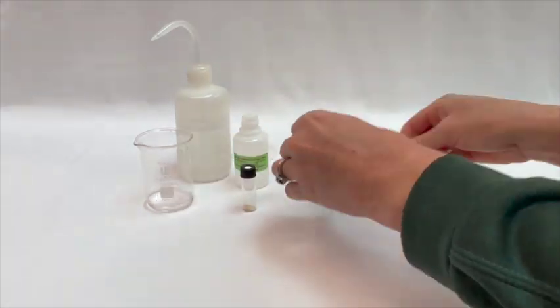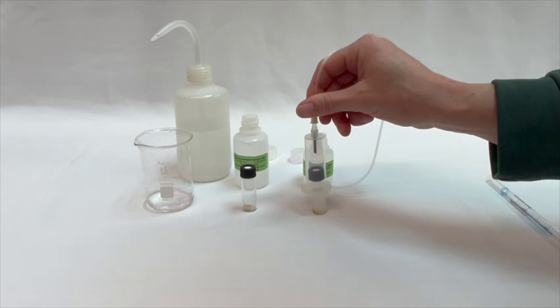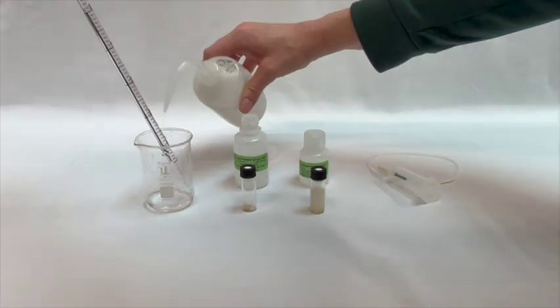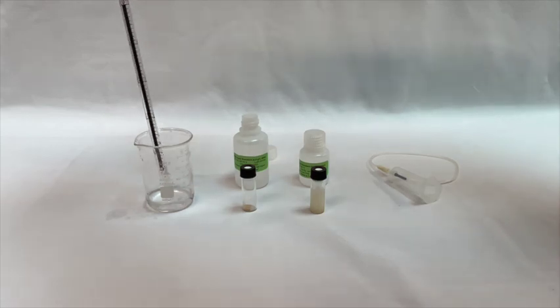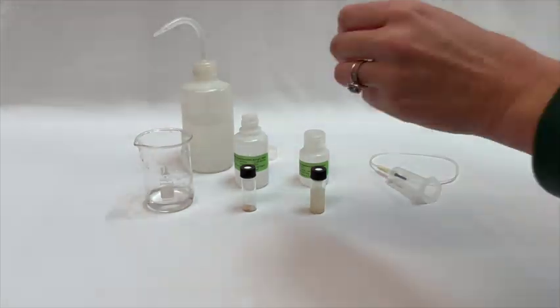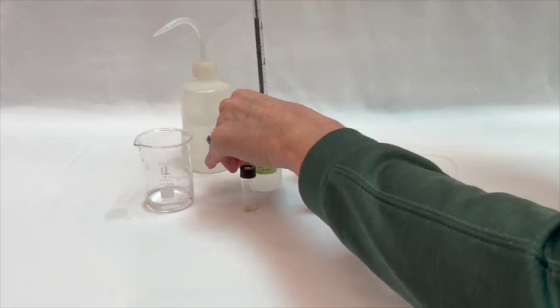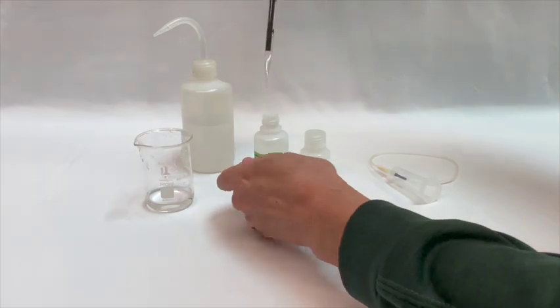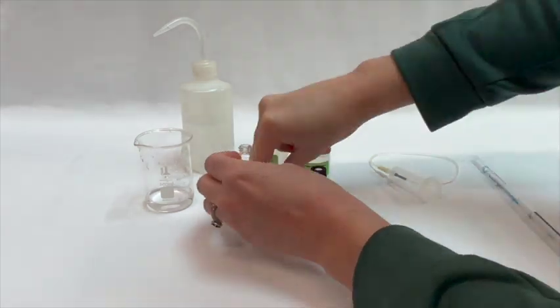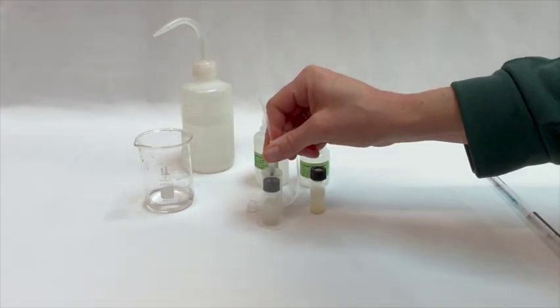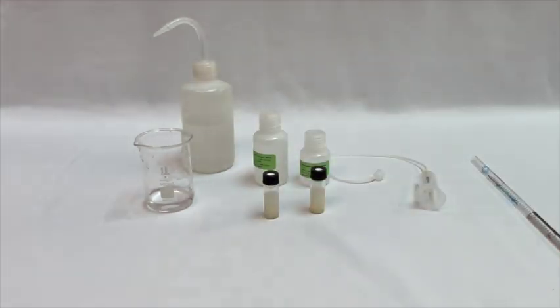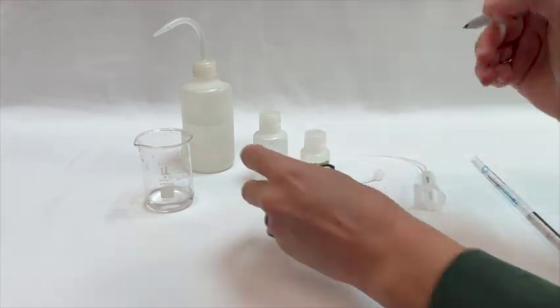Make sure to cap the vial, zero the pressure, and shake for 5 seconds. Also, make sure you label your vials.